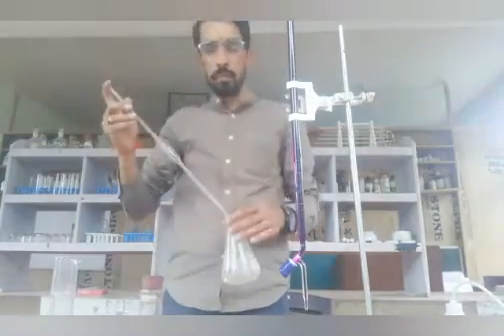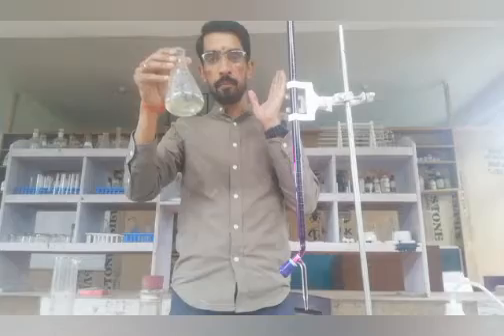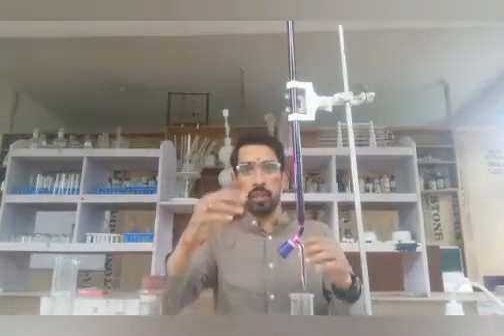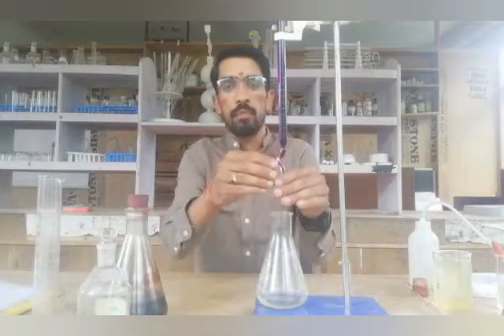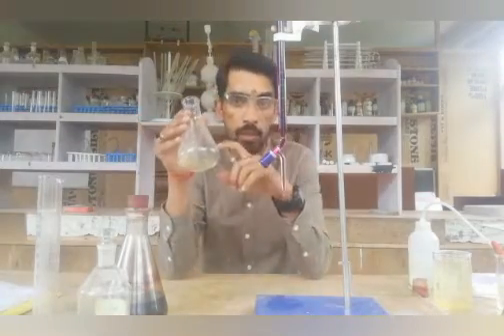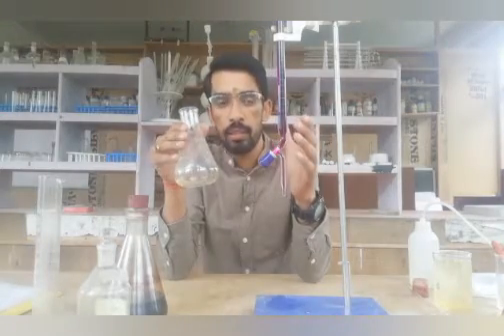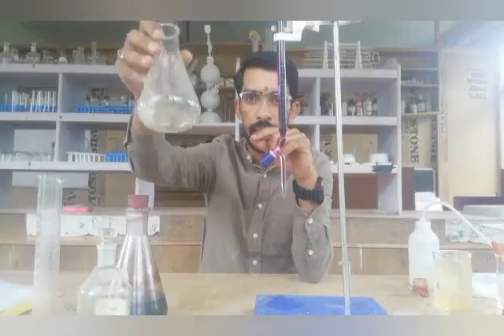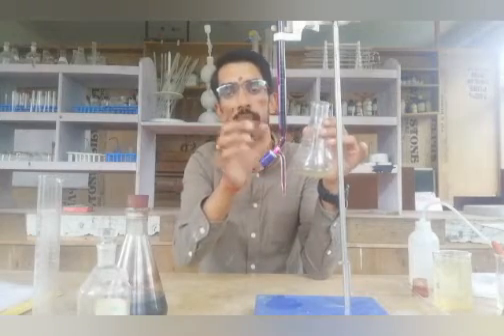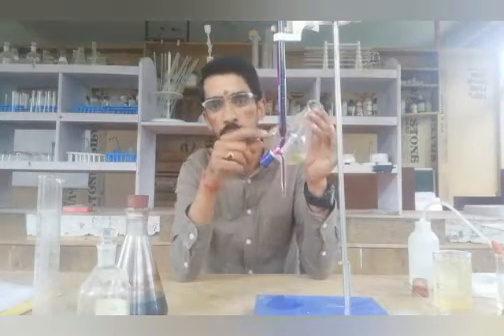How to start titrating? The titration flask has ferrous ammonium sulphate and the burette has KMnO4. I want to mix the ferrous ammonium sulphate with KMnO4 from the burette. The solution in the flask right now is slightly yellow or colourless, but it should become pink — the indicator is KMnO4 itself which will change this solution to pink.